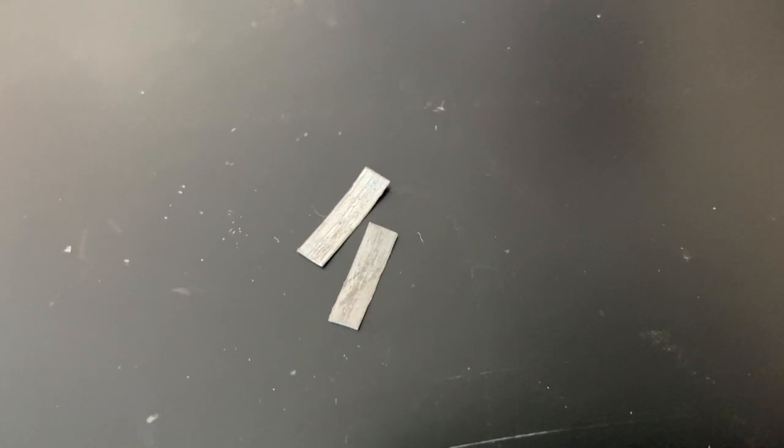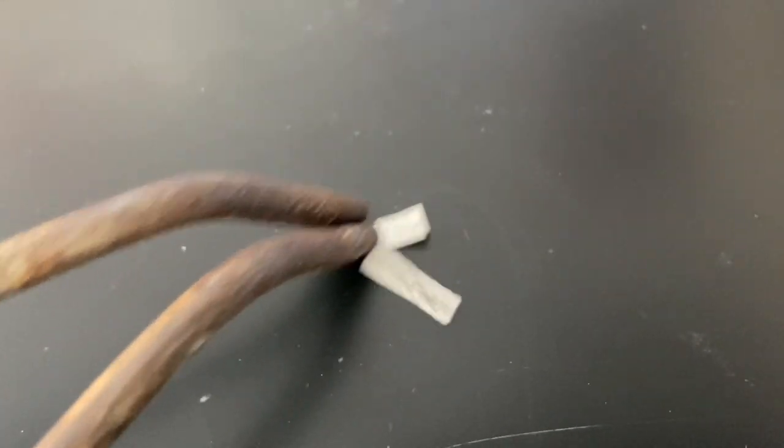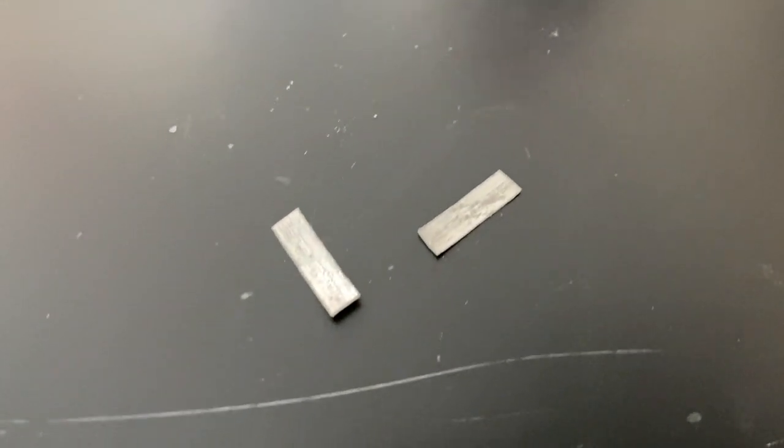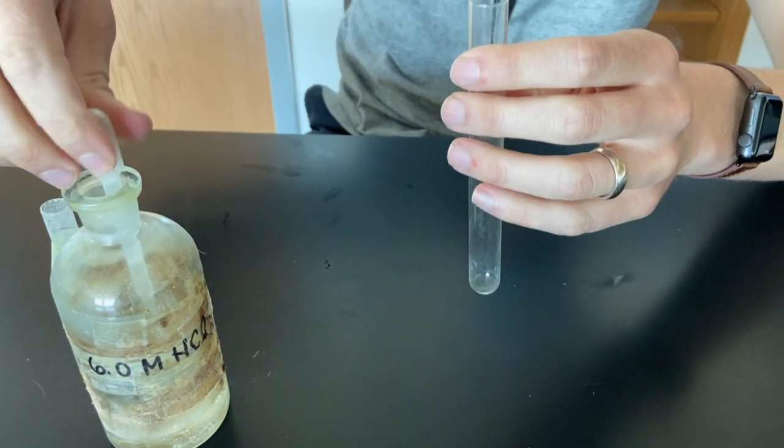Within this step, it says to fill hydrochloric acid into a test tube about a quarter full, which I'm going to show you.